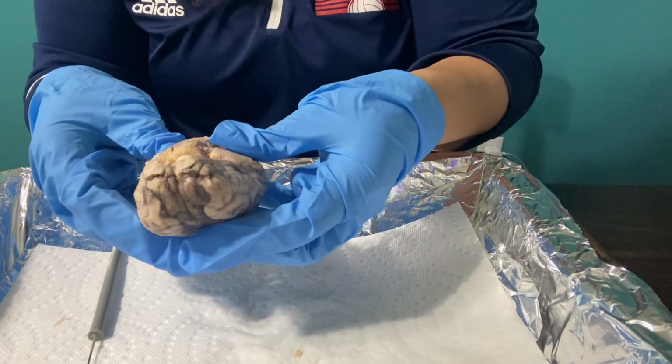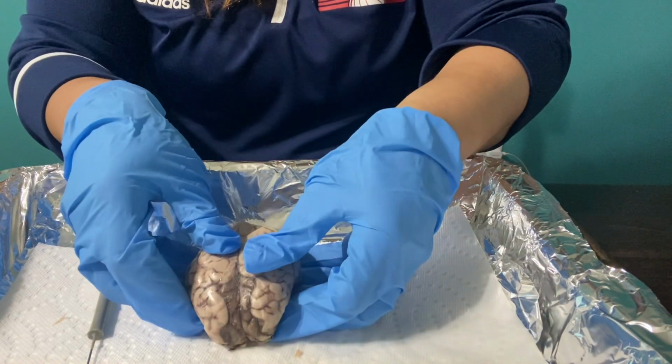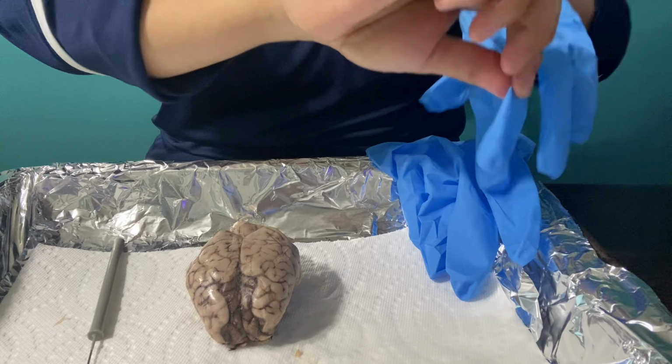Okay, I believe I am ready to open it up. So let me gather my utensils and I will be right back.